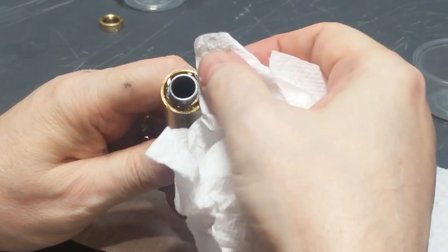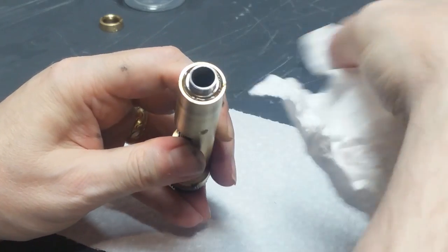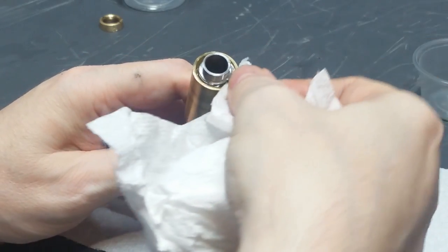Just going to wipe away some of this excess, trying to keep it off the threads on this piece as much as possible. You'll see why later. Okay.